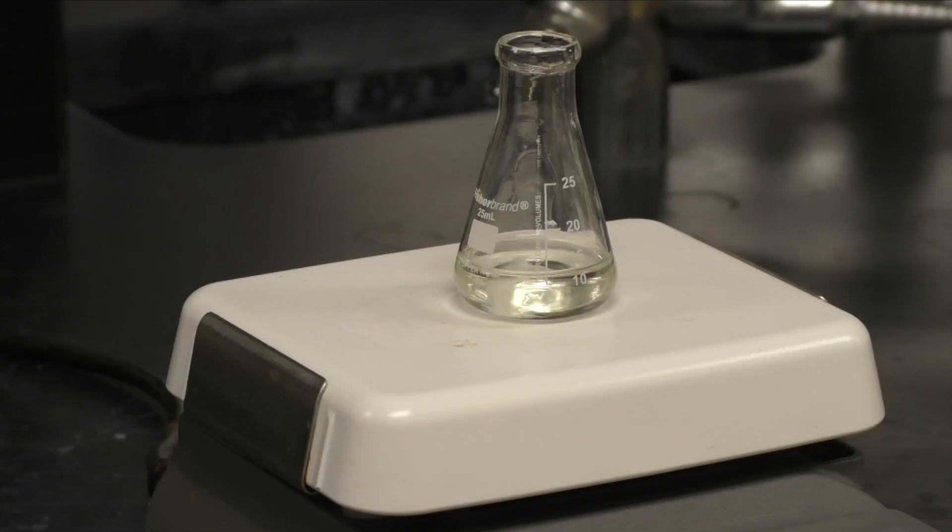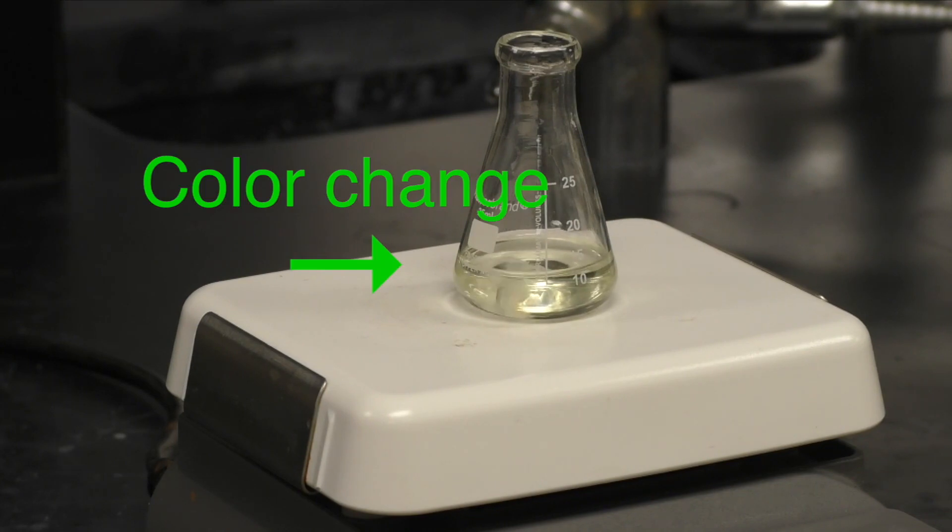Ignore the initial cloudiness. Record the time at which you first see the appearance of color, but do not stop the timer.